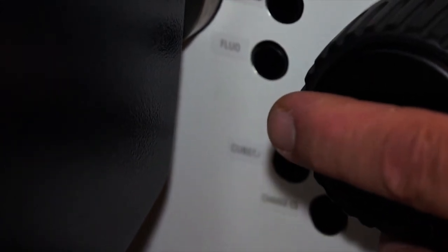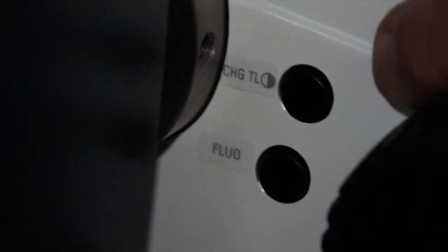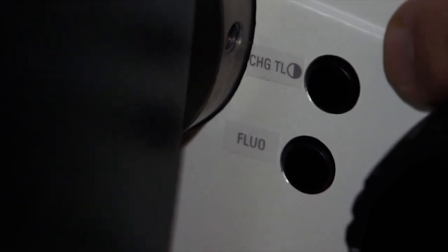4 important buttons are found on the left side of the instrument, just inside the focus knob. The 3rd button down allows you to actuate and toggle between the different filter cubes, just as you did on the front of the microscope. This is very convenient. If you're using 2 different fluorescent filter packages, you can toggle between them simply by pressing the 3rd button. The 1st button allows you to toggle between the different transmitted light illumination methods that you're using.